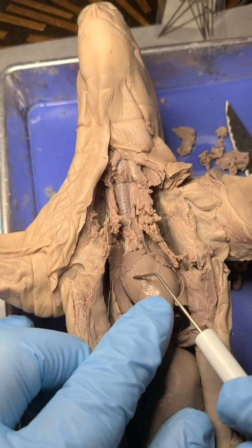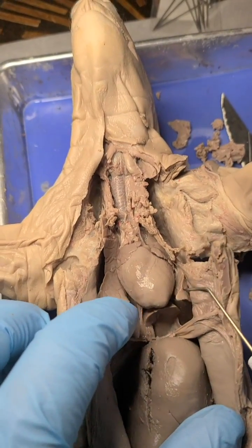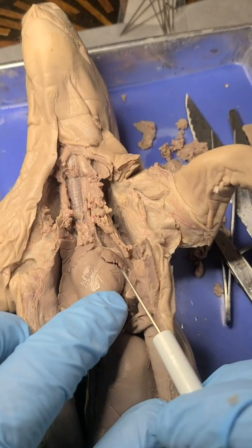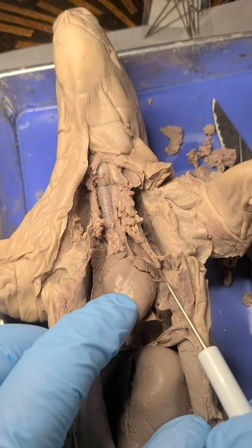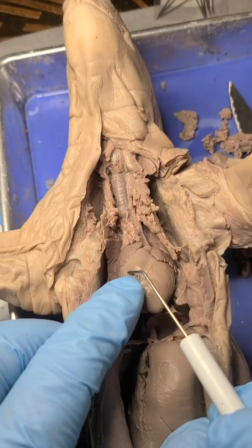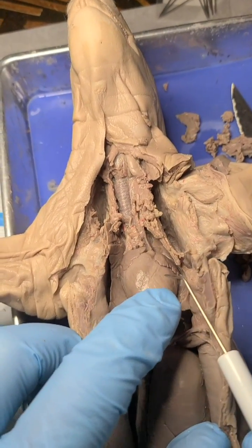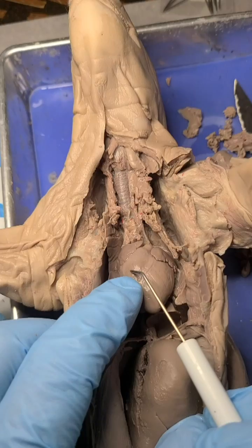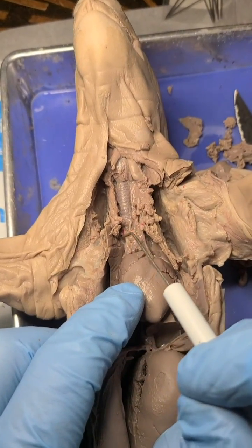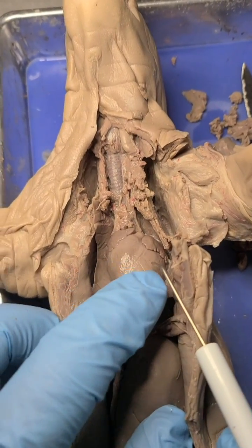Now we have blood in the heart. Galen did not understand that the heart was going to pump the blood on the right side through the lungs, and then the blood would come back on the left side of the heart and be pumped out to the body. He did not understand that circulation from the heart to the lungs and back. What he thought was going on was the blood entered on the right side and then made its way through the wall separating the two ventricles — called the septum — into the left side of the heart. Some blood did leave the right side and washed and nourished the lungs, but it did not come back to the heart on the left side.